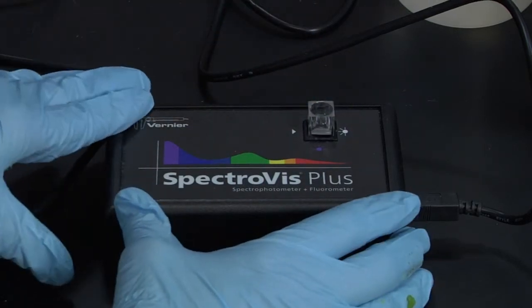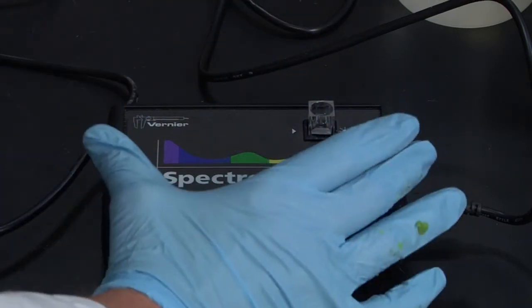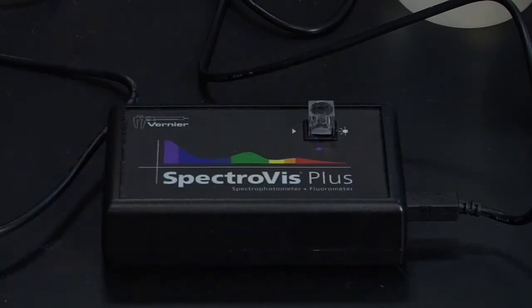And every time you use this, you have to calibrate. So we're going to calibrate first with water because our solutions were made with water.